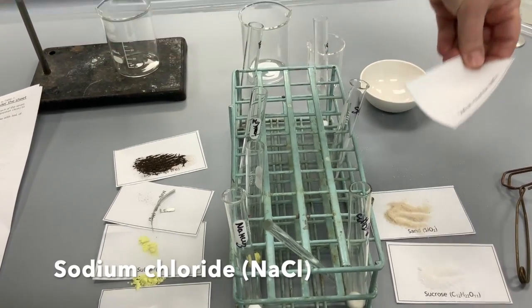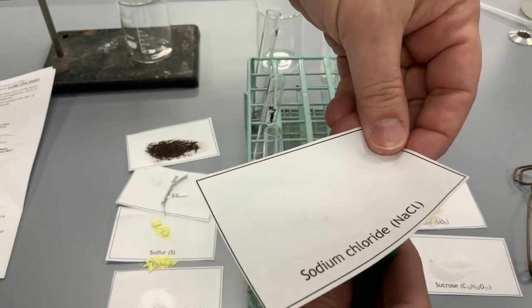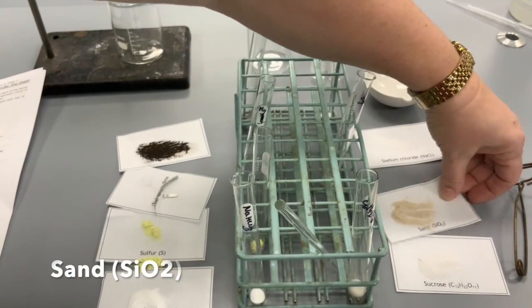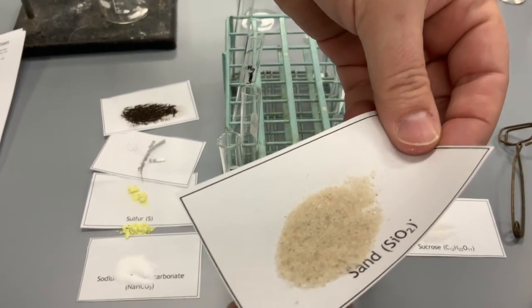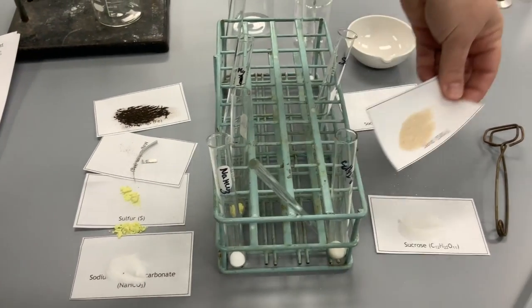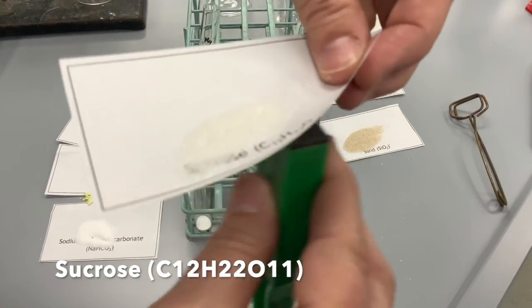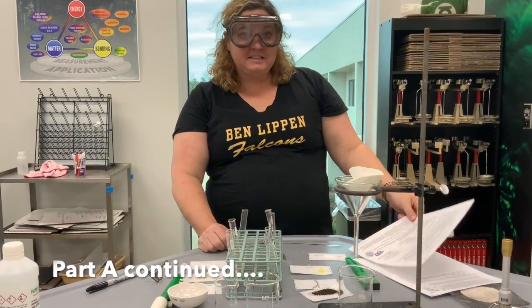Sodium chloride. Not magnetic. Sand. Not magnetic. And sucrose. Not magnetic. Ready? All right, so now we're going to continue with this lab.